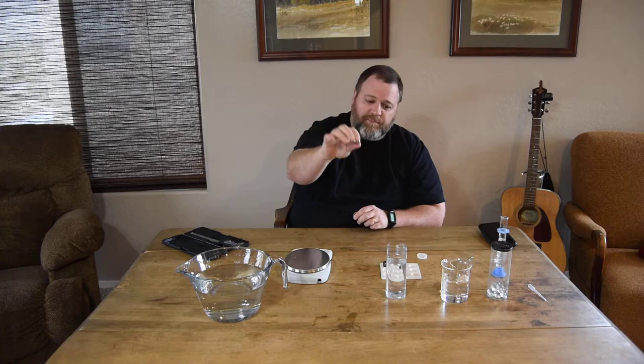So what I want to talk about in this video is another way to determine the density of glass, and it's a technique called the float-sink technique. The float-sink technique is exactly what it sounds like. We learned that when something is denser than the liquid it's placed in, it's going to sink. For example, if I take this very dense steel ball and place it in water, it sinks right to the bottom, because steel's density is much higher than water. Water's density is almost exactly one gram per milliliter, and steel is much more dense.